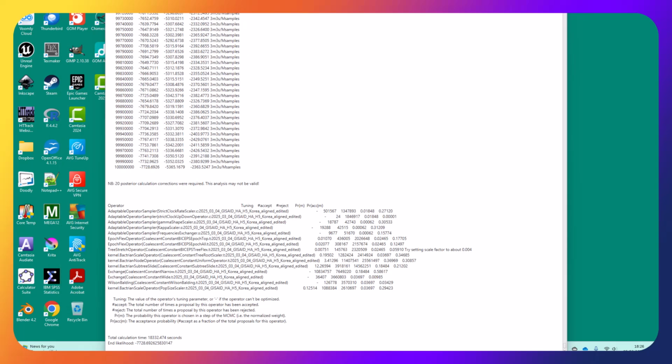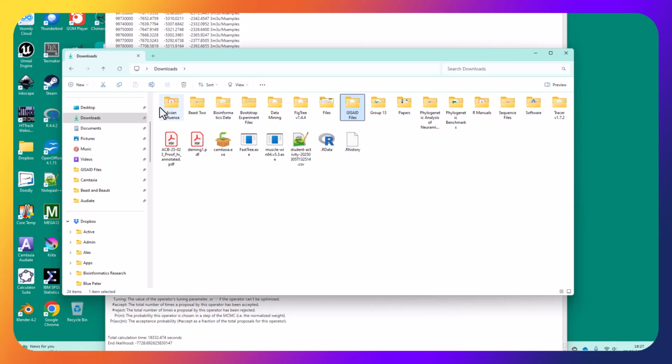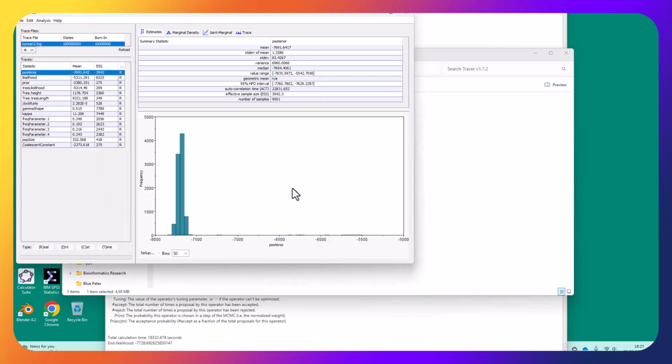So again, I need to go back to Tracer and see if this one's performed better. So first I run it for longer, and second I've also changed the model so that it's on the constant population. So if I click on Tracer, run on Tracer, exe, file, import the trace file. Not in documents, it's in downloads. Downloads. Oh, no, not that. Downloads. And it was in GISAID. And it's the Korean 2 log because it's my second model.